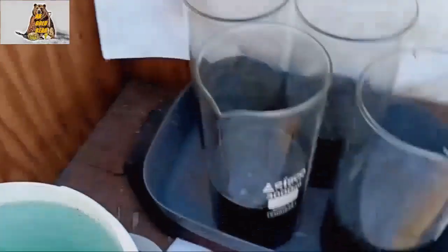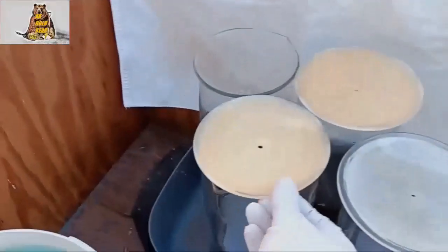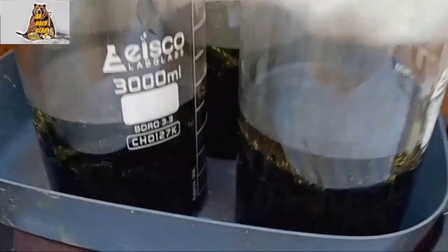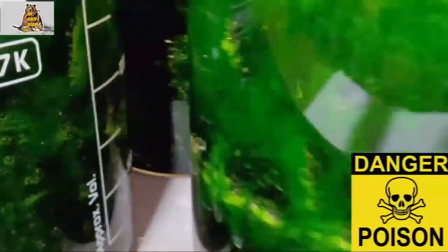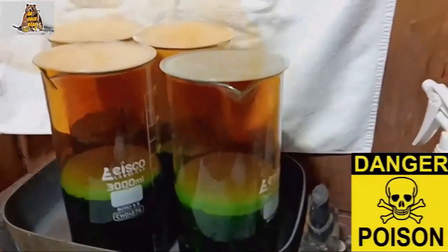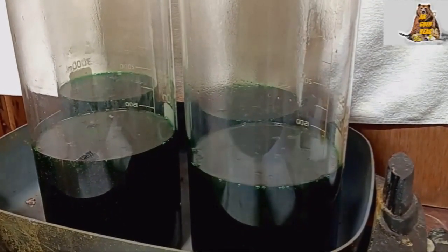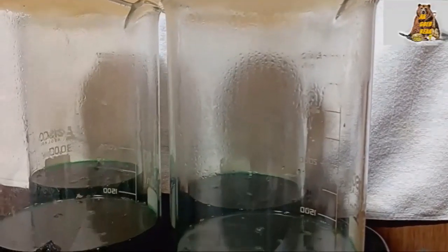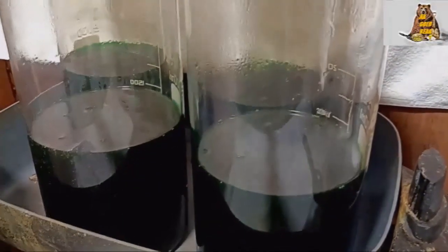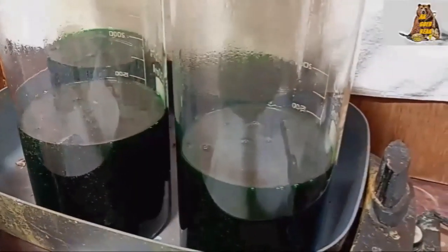Adding 50 more, 50 more, 50 more — all the pins have been dissolved. There are some bubbles, but it's just because the solution is hot.